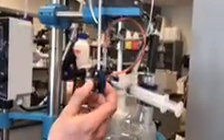Now that same sample would be here. We'll come around through, and now once you see your sample is ready, you can actually look at it in your bulb. If you come around to this other side, Michelle, I'll show you. So now once we have the sample ready, we open this port, we shut this bypass off, and now as we pump, you will see the syringe will fill up. Again, it'll all be clear, so we'll know exactly what we're putting into here. And so you pump the primer bulb to fill the syringe.